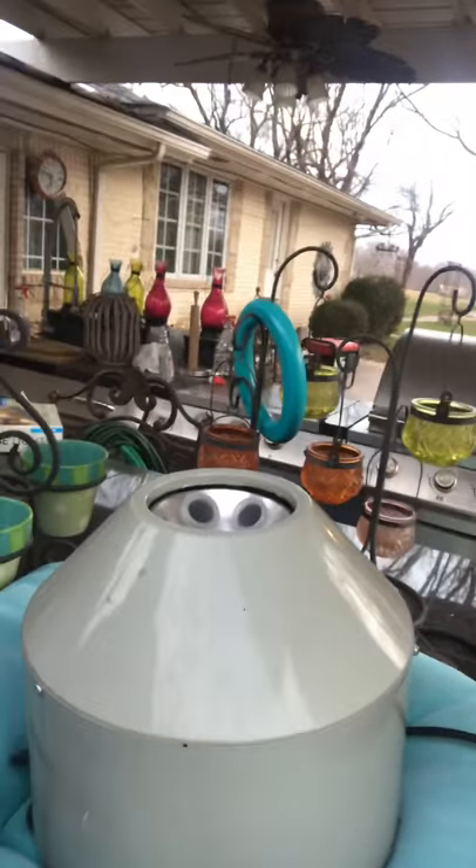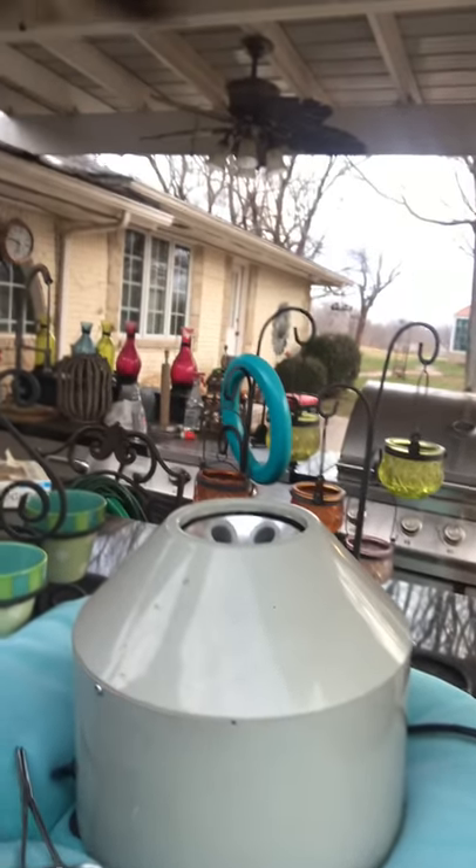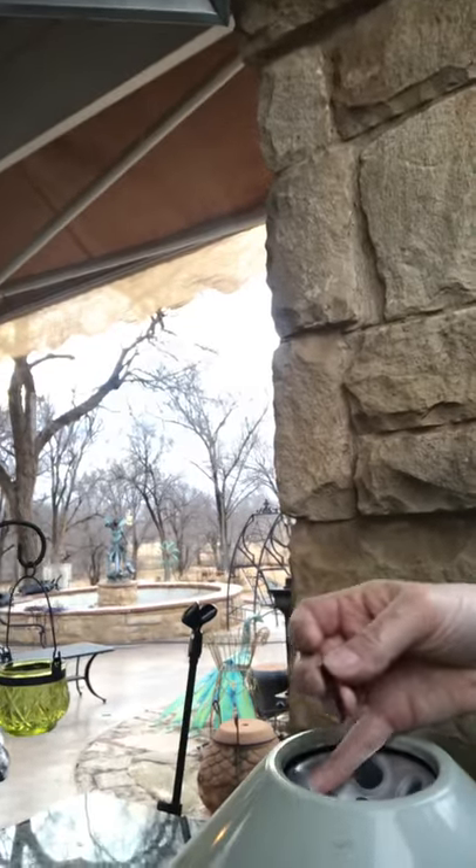What I do is use a centrifuge — I actually sell these products. It's about $85 for a centrifuge. It's a great way of doing it because it's really quick — it separates the blood in just a couple of minutes. I'm going to set this up. I drop the cap into one of these little holders here.